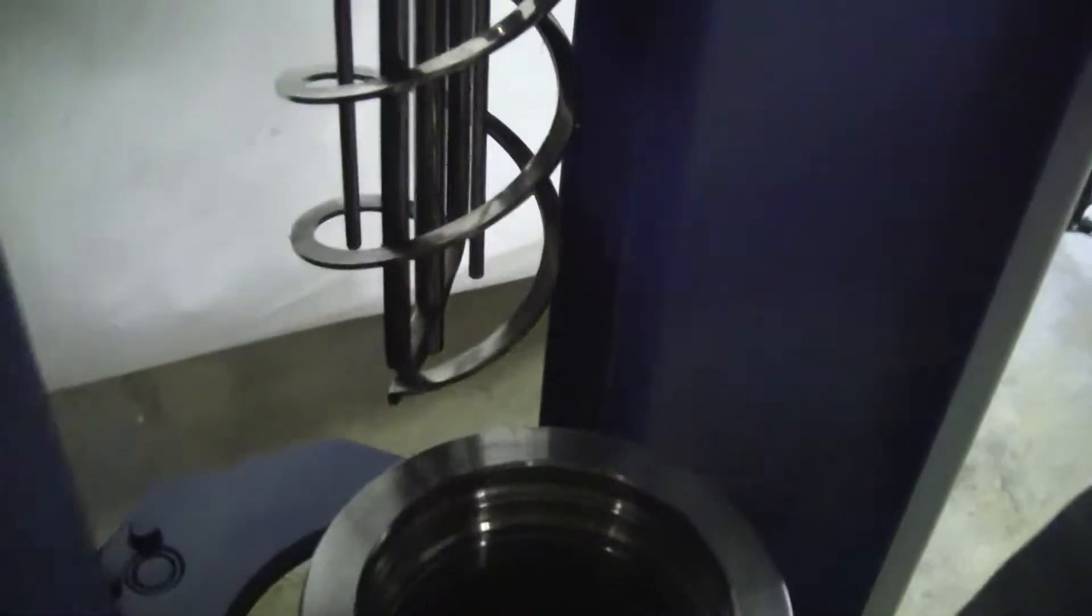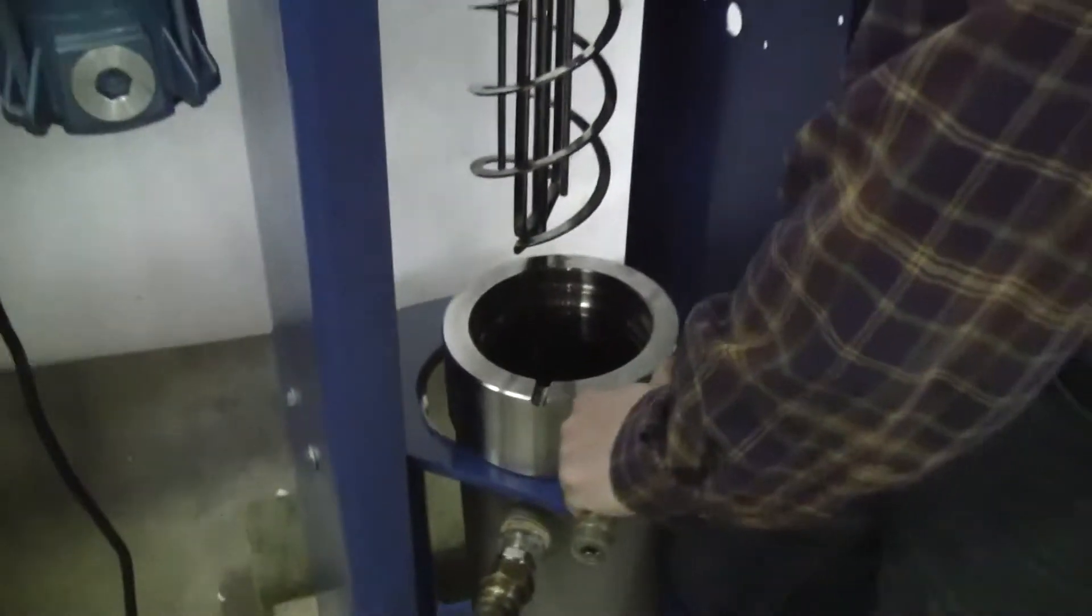Wonderful. This slides into the unit. You're moving that in.